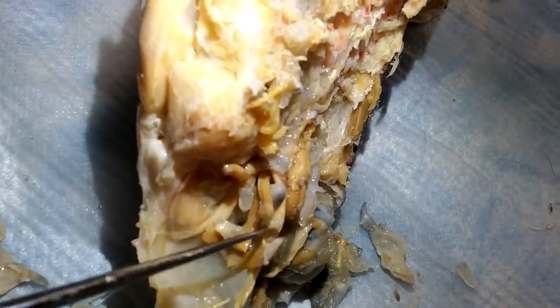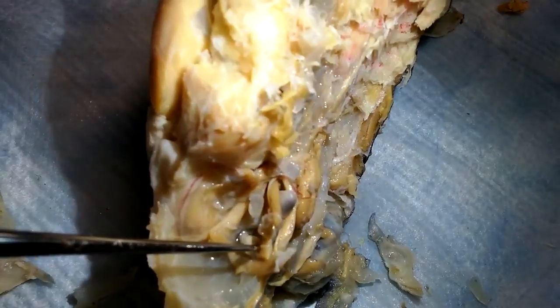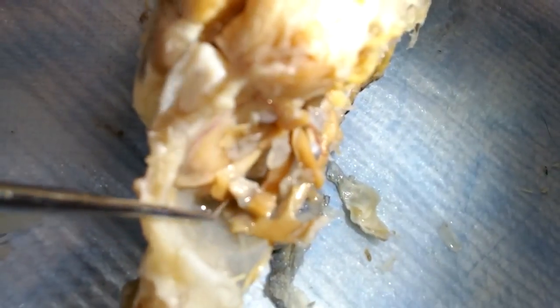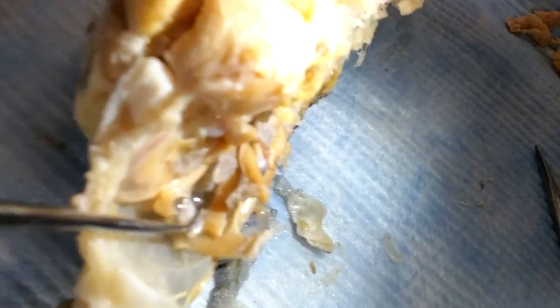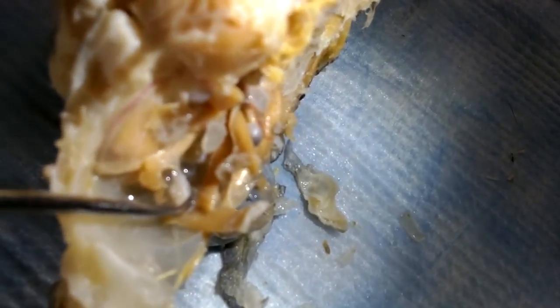You have to look in the eye for the rest of them. The optic nerve would be the one coming from the middle — this guy right here. If you look at it, see that right there? That right there is coming directly from the eye — that's the optic nerve.